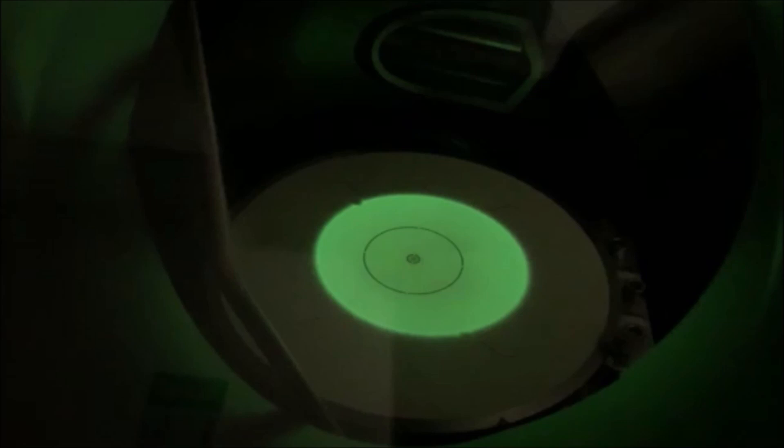So then you're going to have to go back into diffraction mode and again adjust the sample tilt to re-realign to the zone axis. And so this is somewhat iterative. And then again, you'll have to go back and re-establish eucentric height. And the adjustment should be smaller each time, but this is usually somewhat of an iterative process rather than just do it once and then go back and set the height and then everything will be good. Especially if you're trying to make sure your zone axis alignment is as precise as possible.